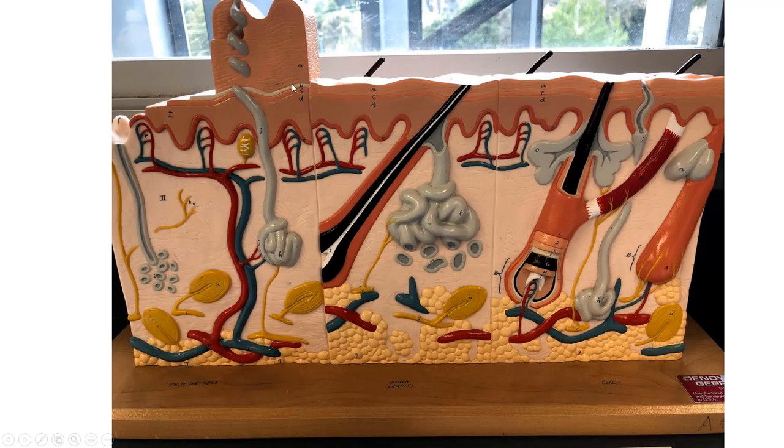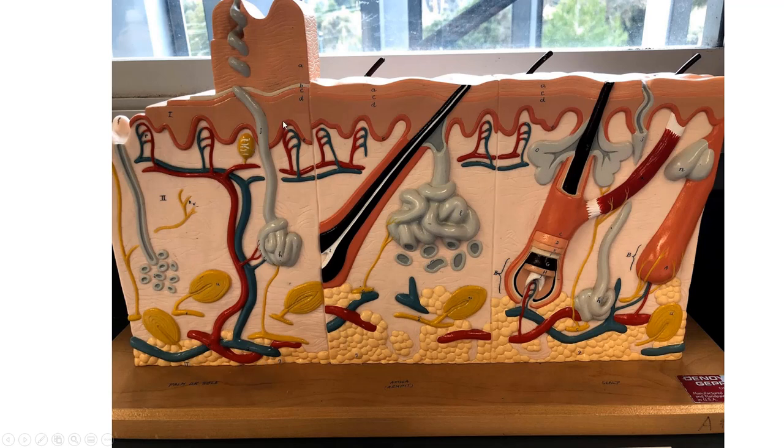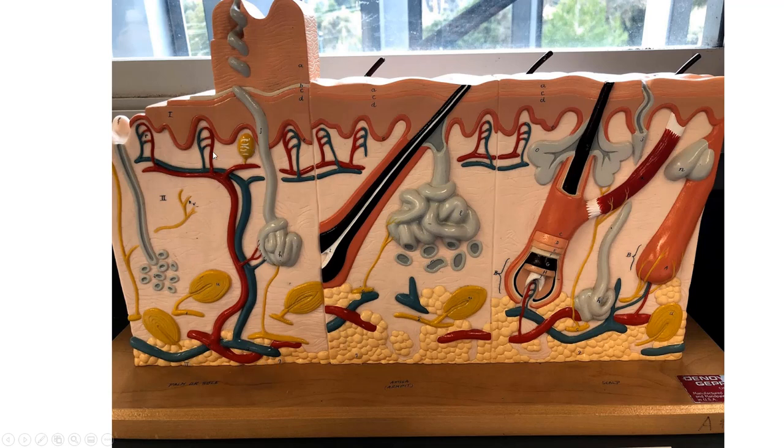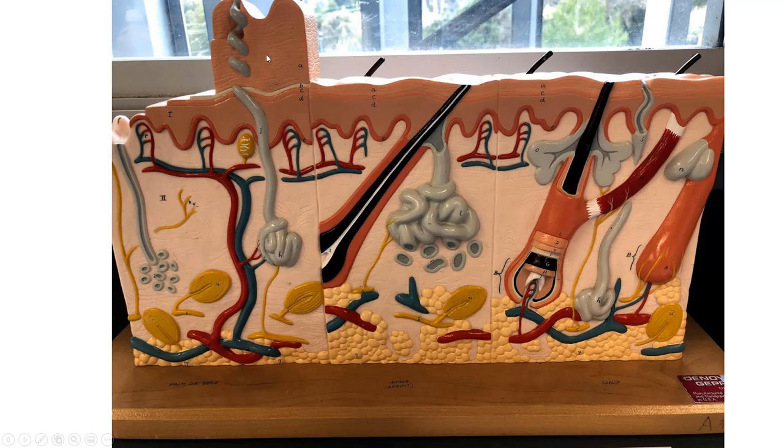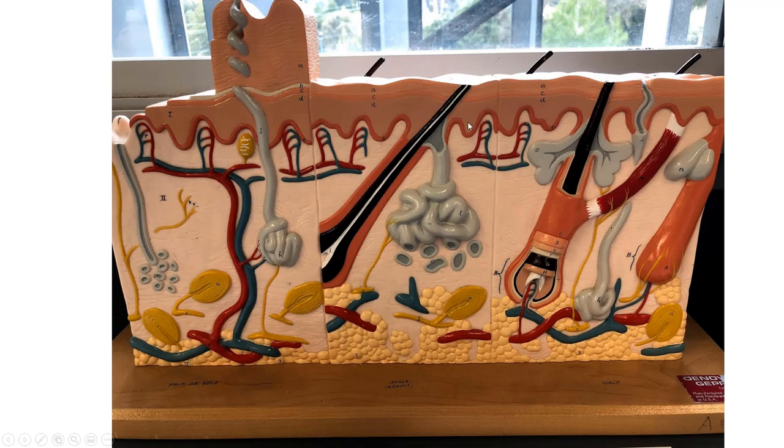These are your sebaceous or oil glands secreting into the hair follicle. The last thing to point out is that this is thick skin — you can see it because it has the stratum lucidum — so this would be from the palms or the soles. It also has a very thick stratum corneum.